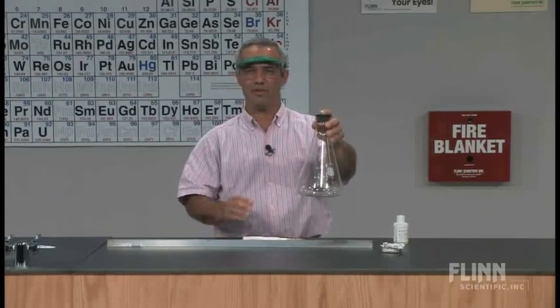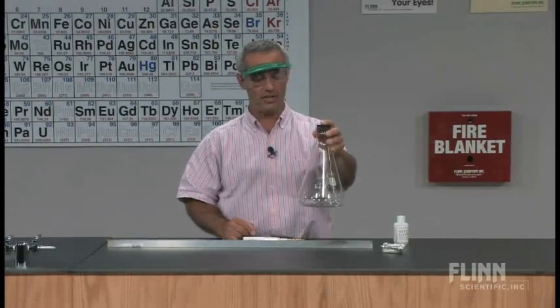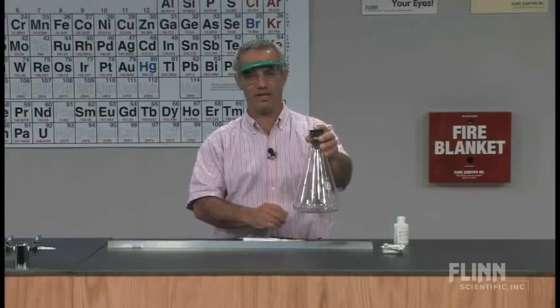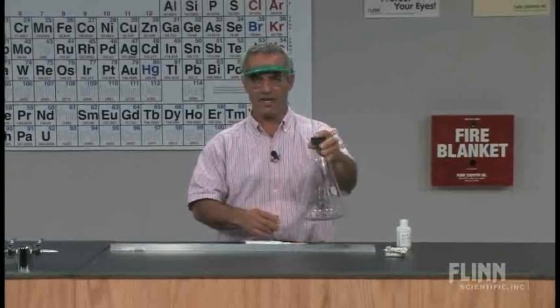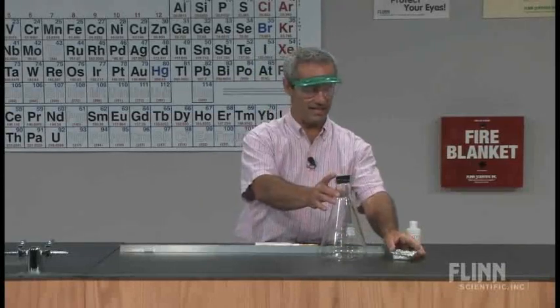At room temperature, the vapor pressure of petroleum ether is around 400 torr, which is enough to make about a 60% petroleum ether vapor, 40% air mixture in there. The important thing about that mixture of vapors is that it's dense. Oh, there it goes again. It's a rather dense combination.